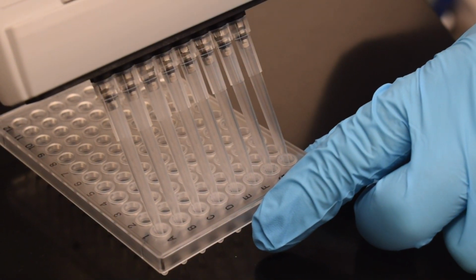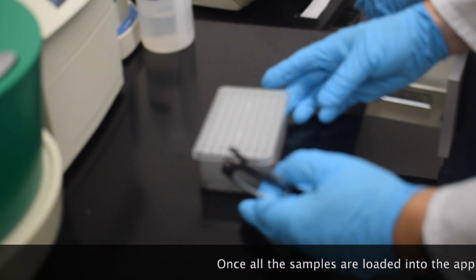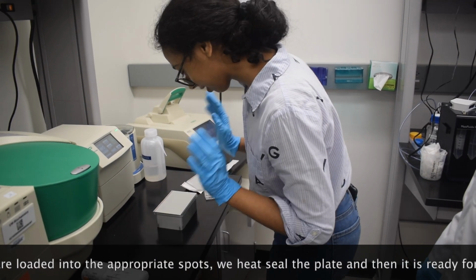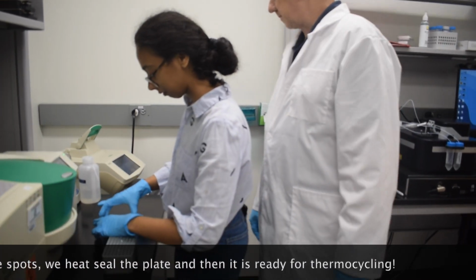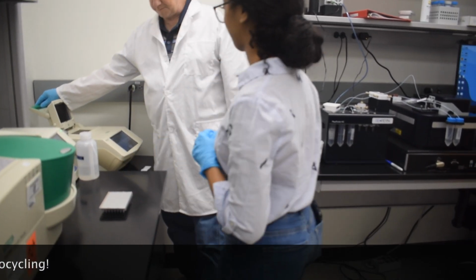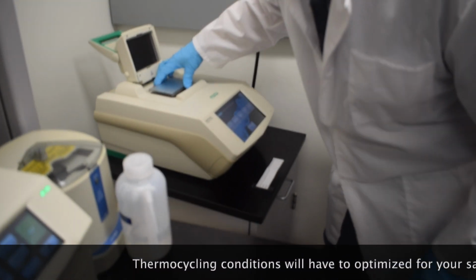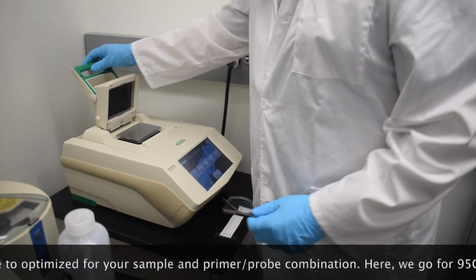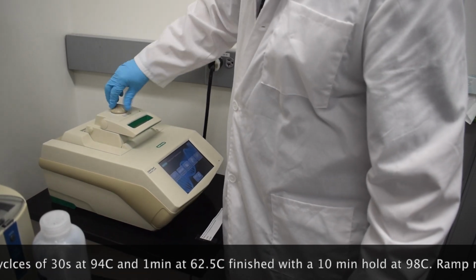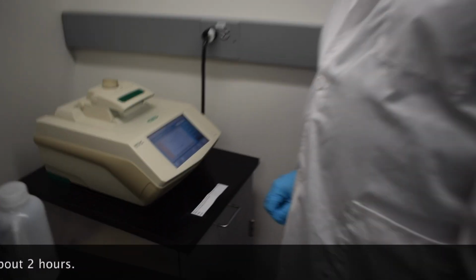Okay, so the samples are loaded into the PCR plate, and they're in the block for the heat sealer. Alright, so now you have your sealed plate with your samples in it. The droplets are made, they're loaded, and that means it's time for PCR. So we put the PCR plate in the thermocycler. You close the lid. You tighten the nuts. Okay, and bon voyage. Bon voyage!